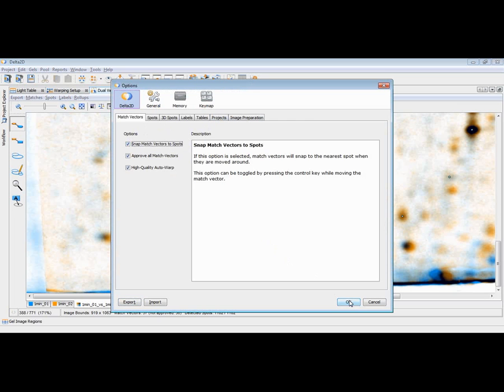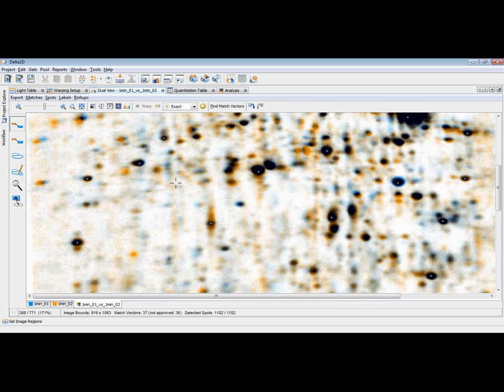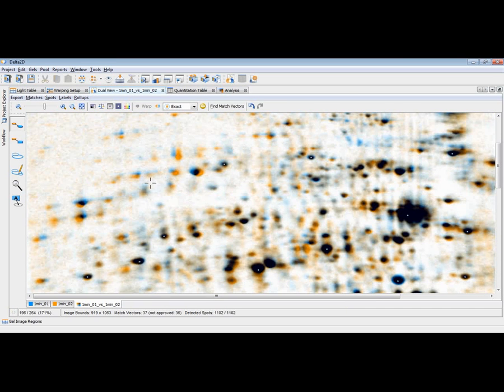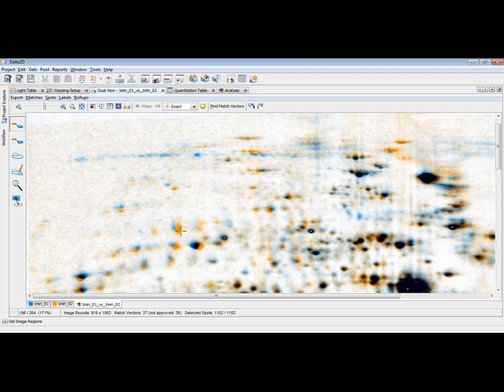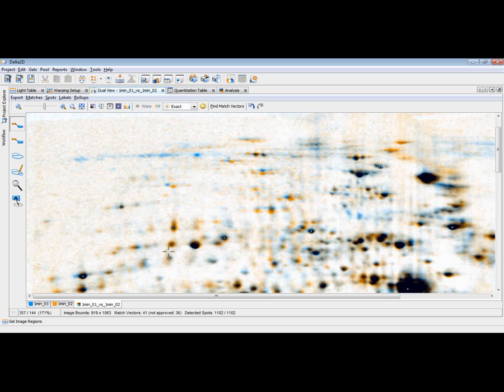I activate that, press OK, and then next let's have a look for additional pairs that need to be warped. We have this in this upper left region, and then I just click next to this orange spot and next to the blue, and as you can see, hopefully the match vector is automatically snapped to the respective two spots, and then it's done rather easy to define additional match vectors. And we apply them, and as you can see, it's done really quickly to improve the matching and the warping which is available for this image pair here at least.